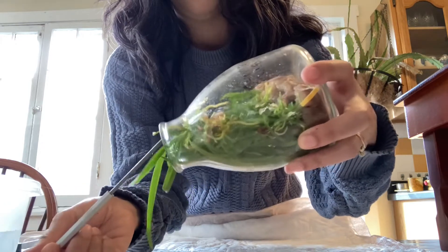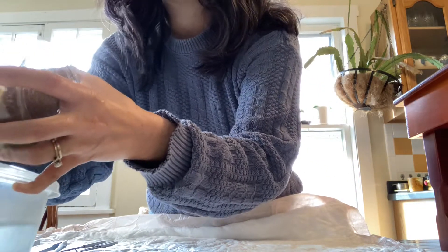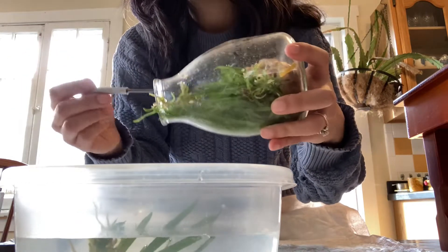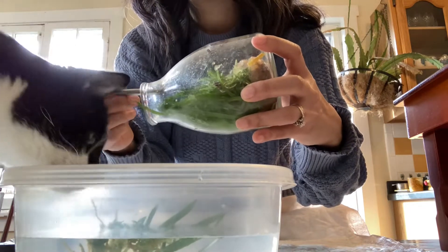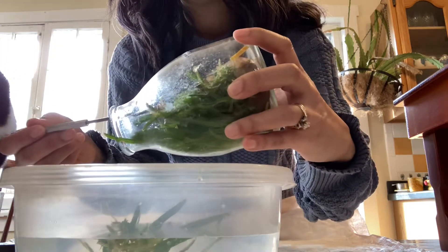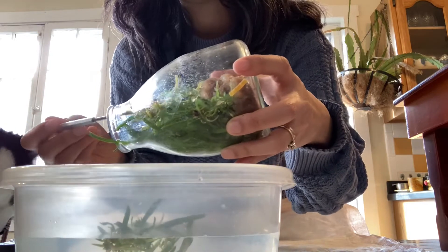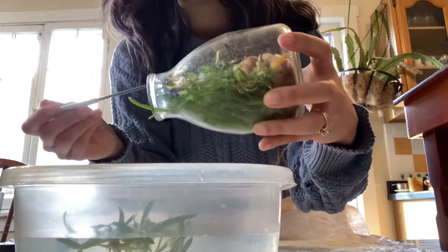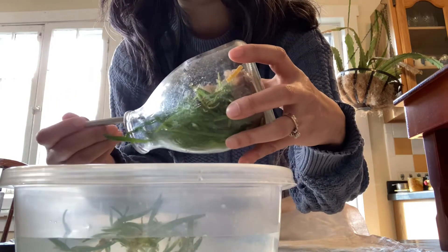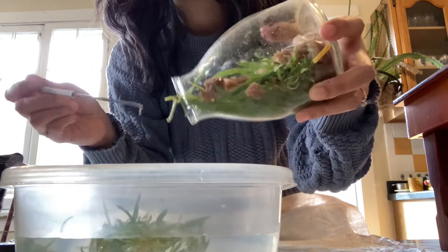Here's one. I hope I am not damaging this with this little hook thing. We'll put this in the water. Yay! First plant. Second plant. If the 90-degree hook works, this will work a lot better than a spatula. I will link my first time I did this with Carmela's flask — I didn't have a hook and how difficult it was to get the little plantlets out of the jar. They're just coming right out.